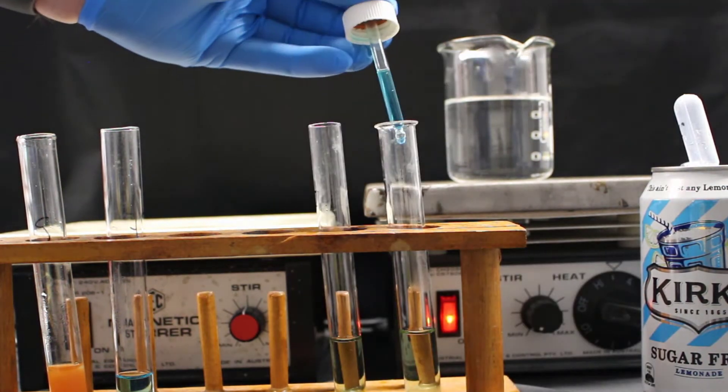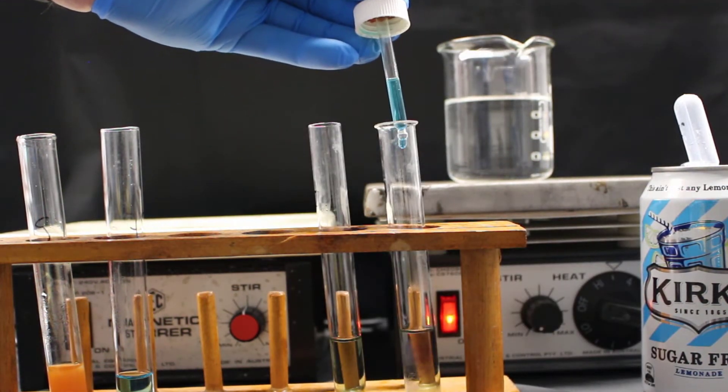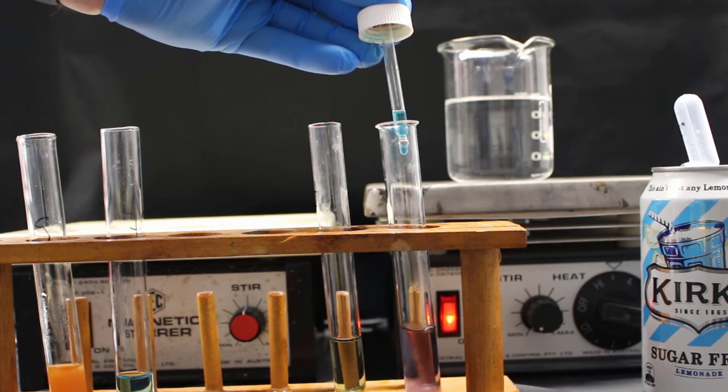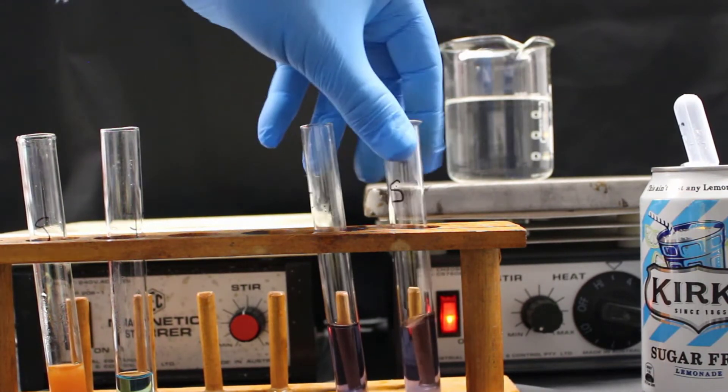Next, repeat Benedict's test again. So 20 drops of Benedict's solution. And then into the water bath for up to 5 minutes.